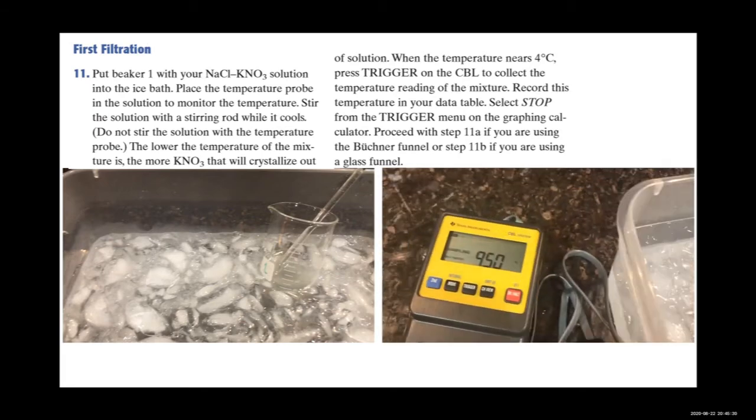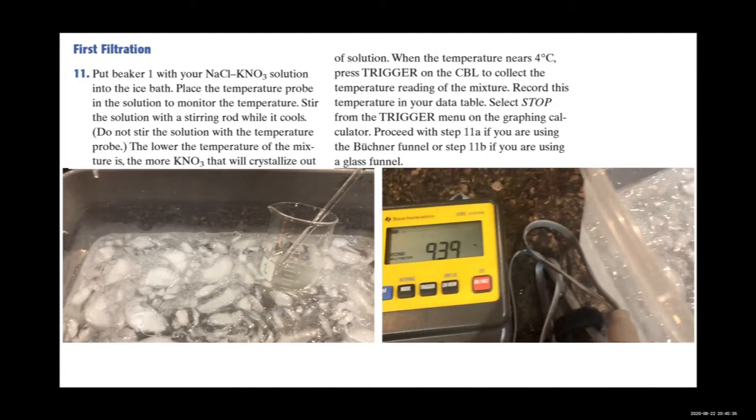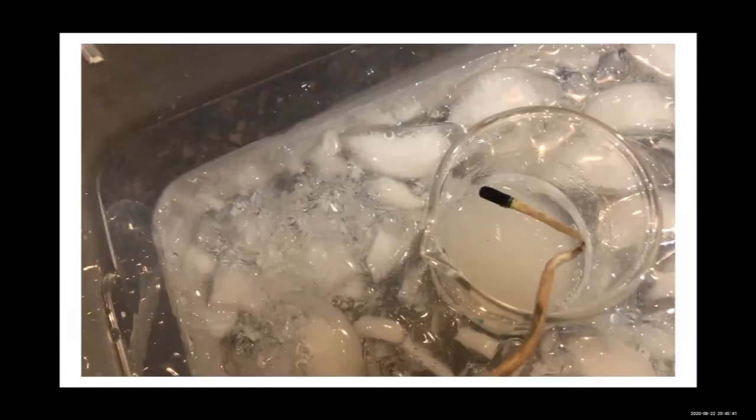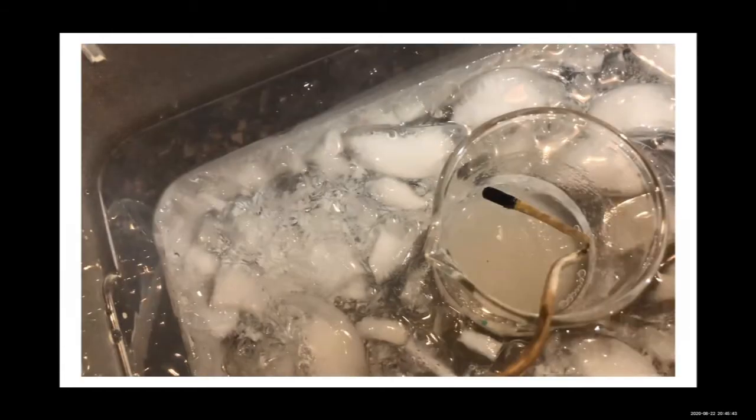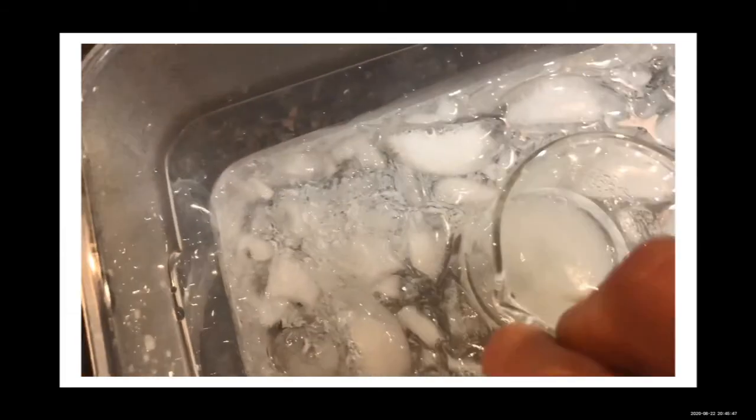When the temperature nears 4 degrees Celsius, this is when, if you were using the graphing calculator, you would press trigger on the CBL. So this is the swishing motion I found worked a little better than the glass stirring rod.